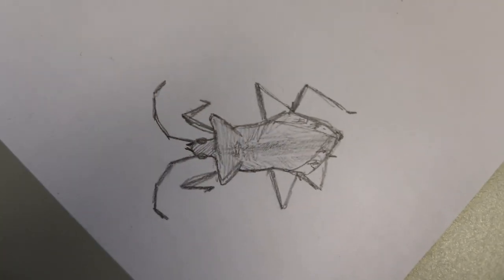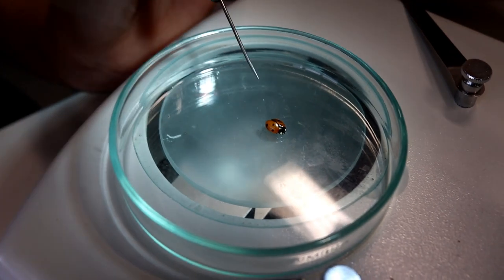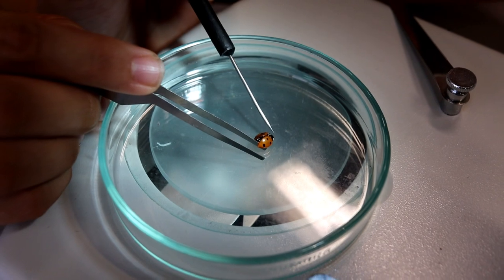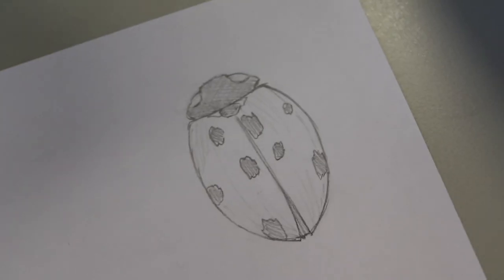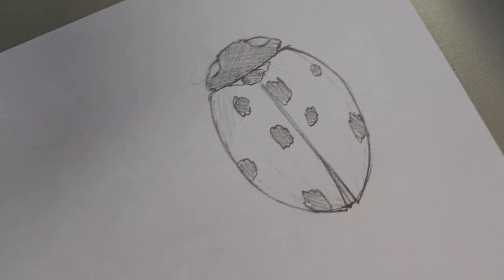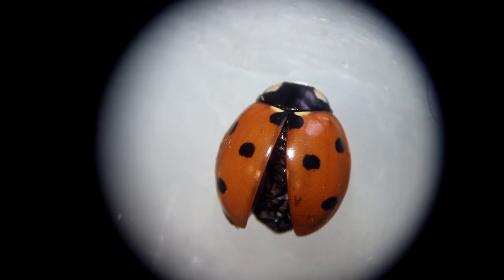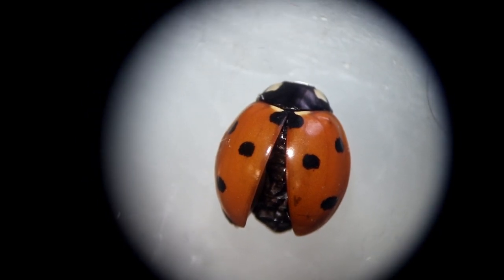Students also had to draw the insects — and here's a ladybug. Students, for example, did not know that ladybugs have two pairs of wings like many other insects. So there are a lot of things that students learn this way. And also for me as a teacher, every insect project offers many new things to learn.